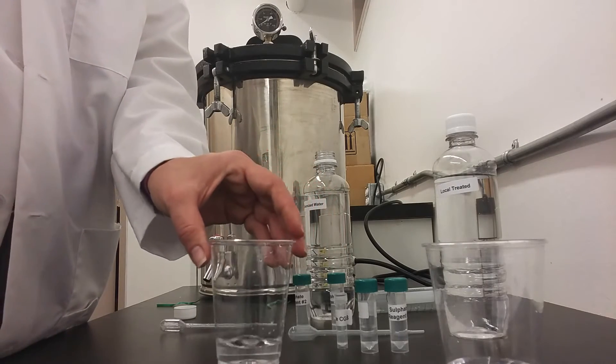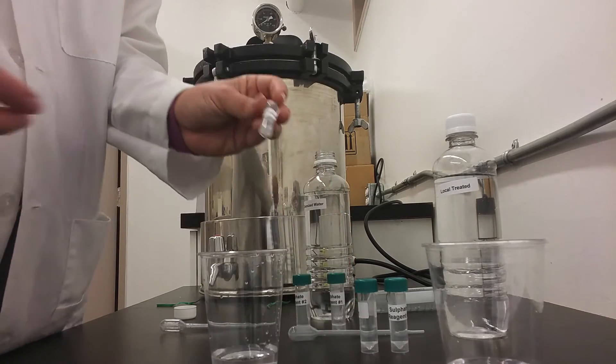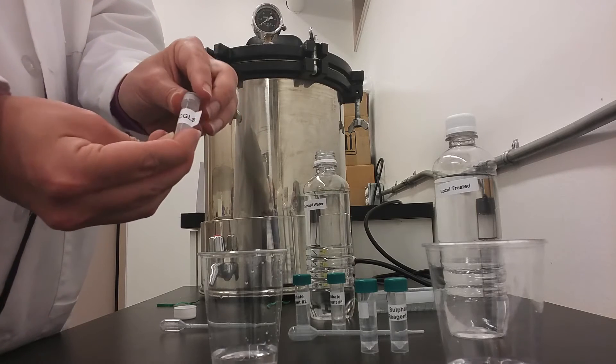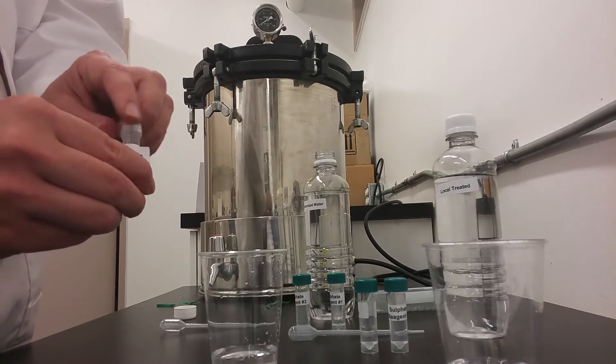For this sample, you will add the 2 milliliters sulfate sample included in the test to the water glass.